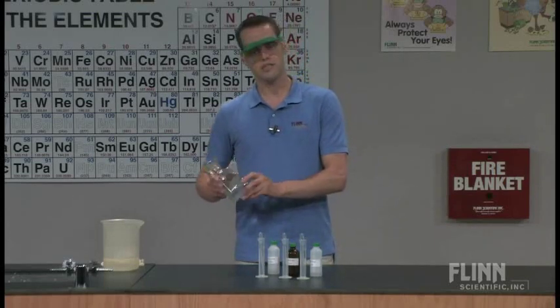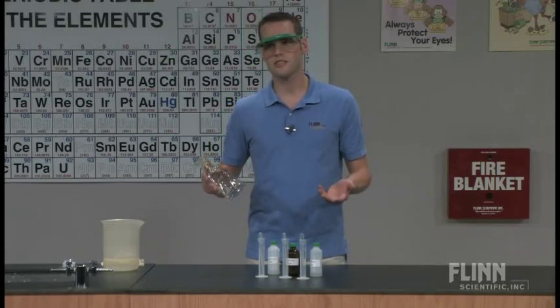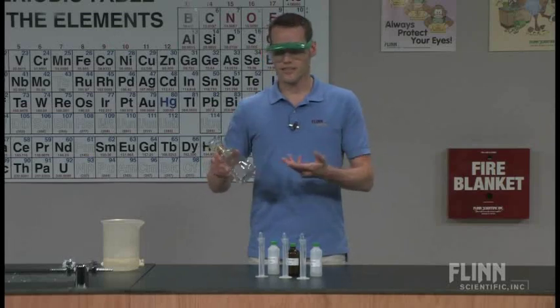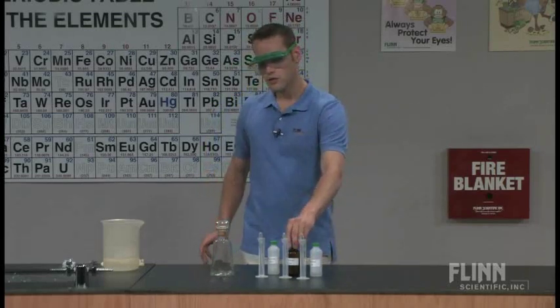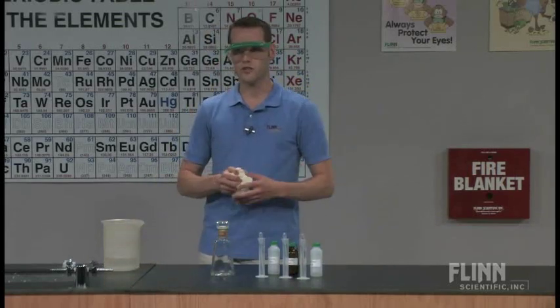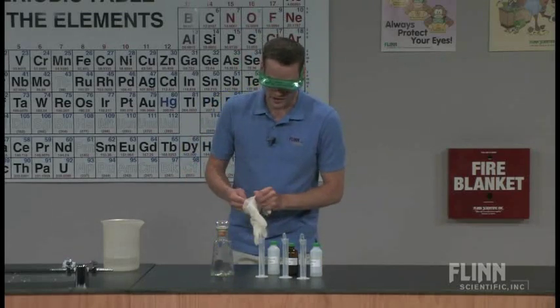This is a fairly large bottle, much larger than 12 fluid ounces, so I'm going to be using 25 milliliters of solution. I usually have my kids use 10 milliliters each but in this case the larger volume needs a little bit more of the reagent. Solution B has silver nitrate in it. Because it stains skin and clothing I usually have my students wear gloves when they do this reaction.